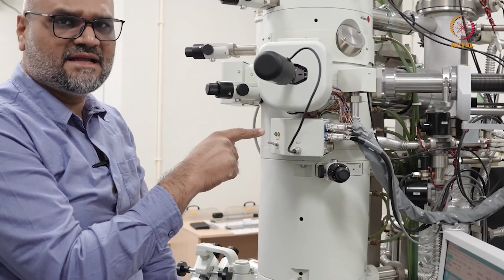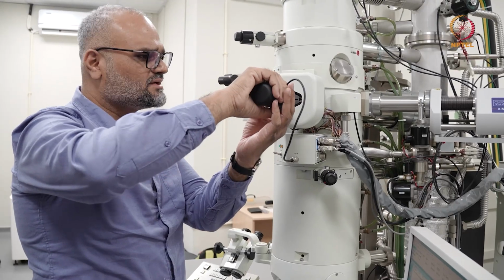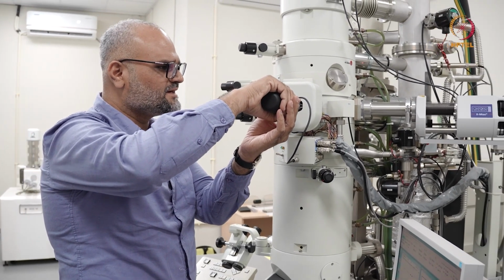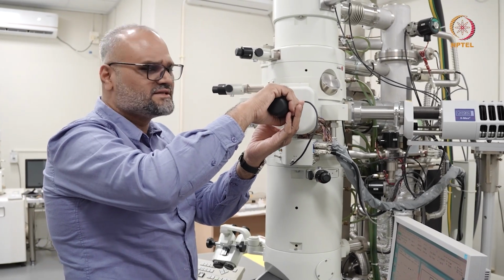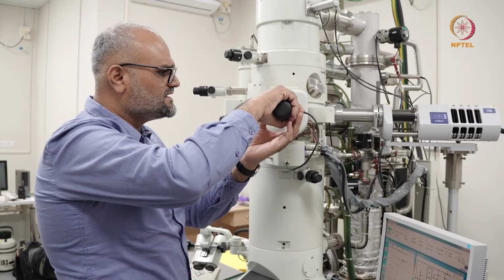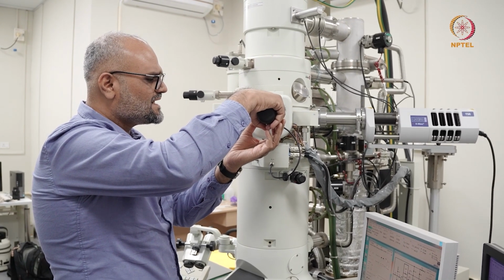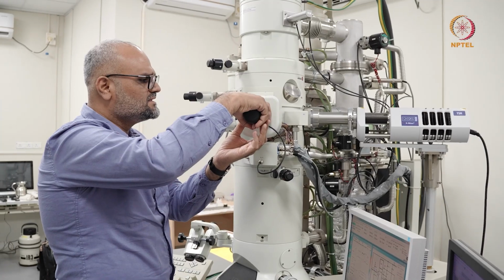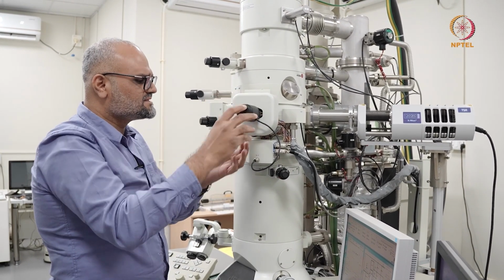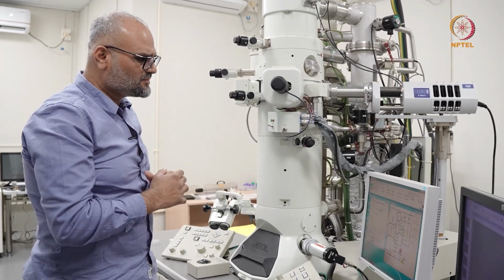Now once the green LED is on, as you see here, I have to carefully turn the holder by gently holding this, and it goes in by approximately, on a 15-degree rotation, it goes a step in. And now I carefully turn it by 75 degrees more clockwise, and I should hold this holder such that it does not crash into my microscope column. So once the holder is in, you are good to go with imaging.